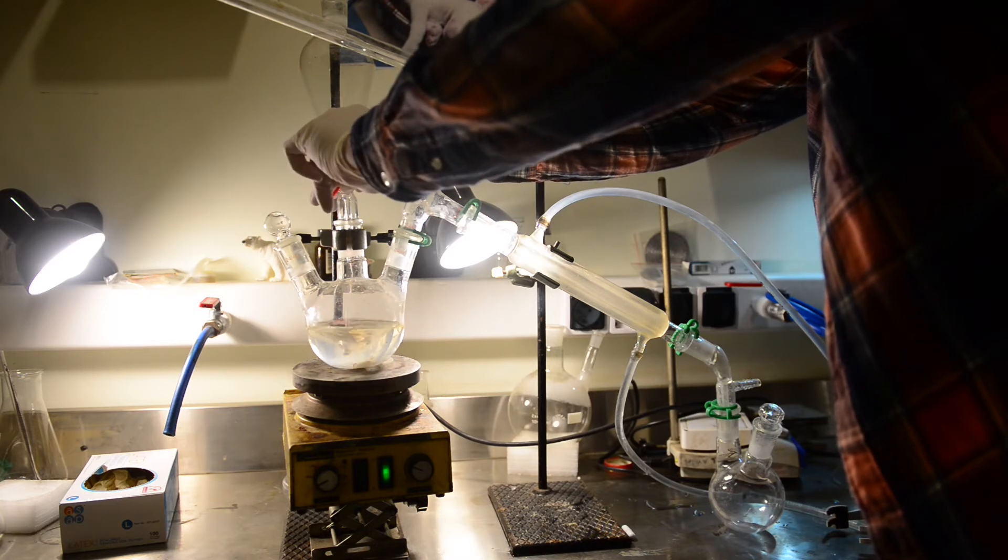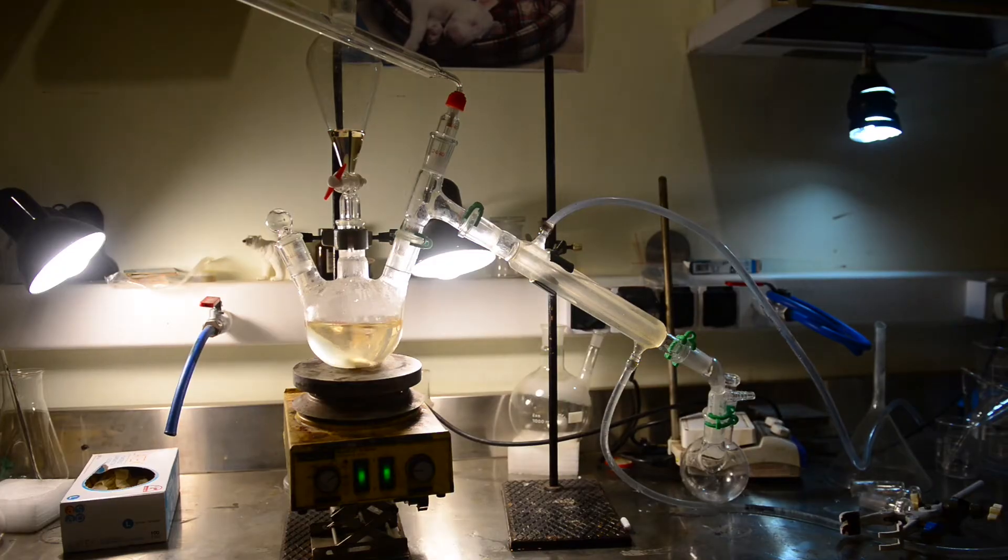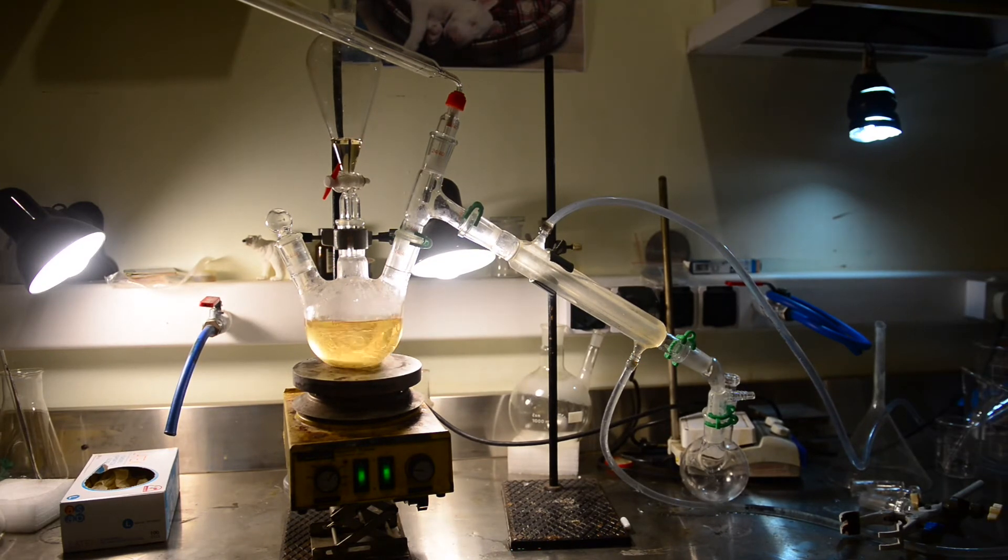but external heating is also necessary for distillation to start. We had the stirrer turned on, and after we started the slow addition of sulfuric acid. After a while, we noticed that self-heating was not enough to start the distillation and applied heat 150 degrees on the hot plate.